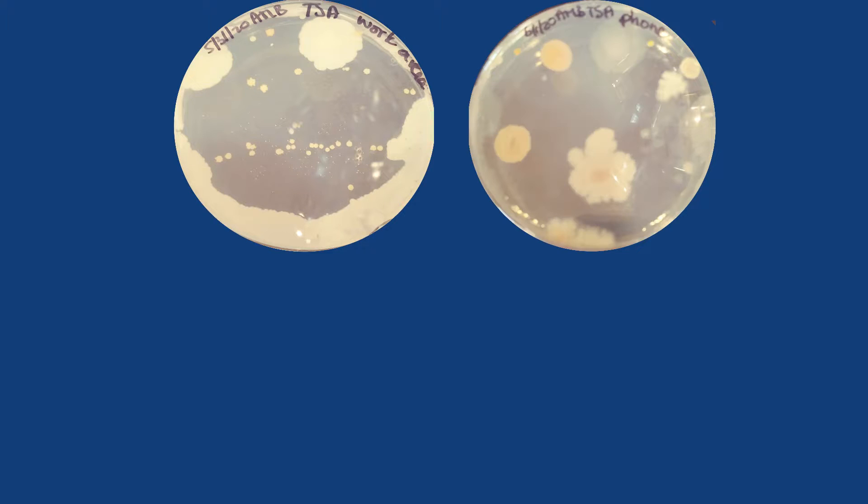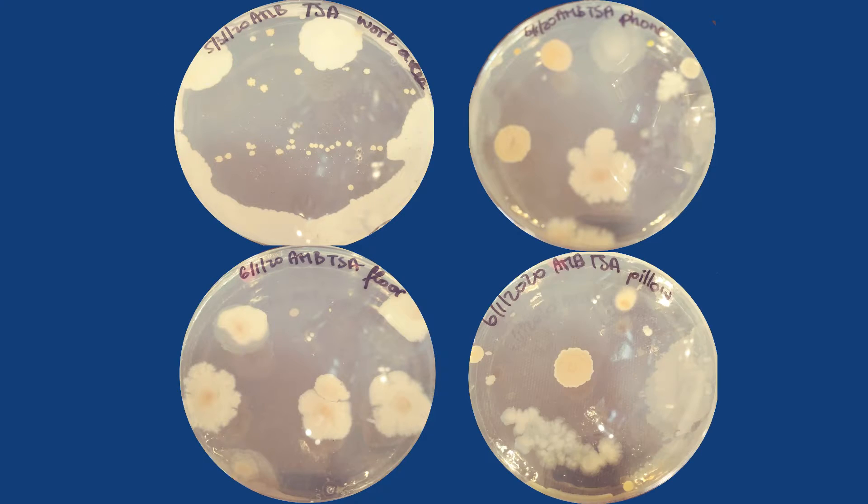You should see bacterial colonies showing up in about two days. Take pictures of your plate and follow the instructions in the colony morphology handout and demonstration video to record your results.